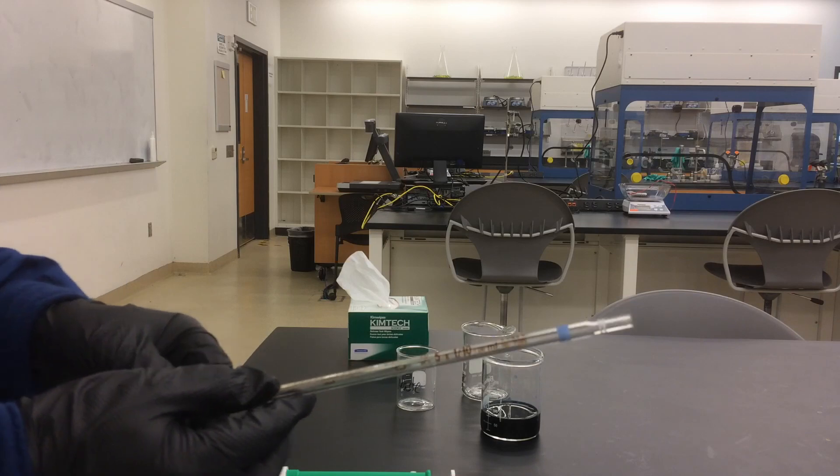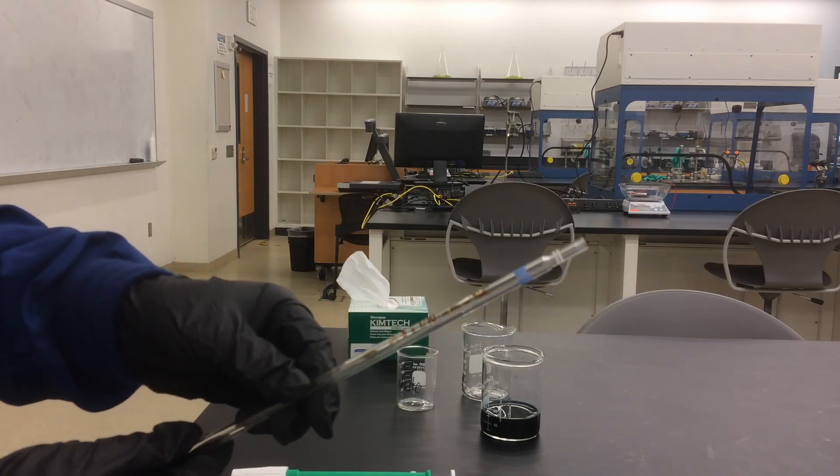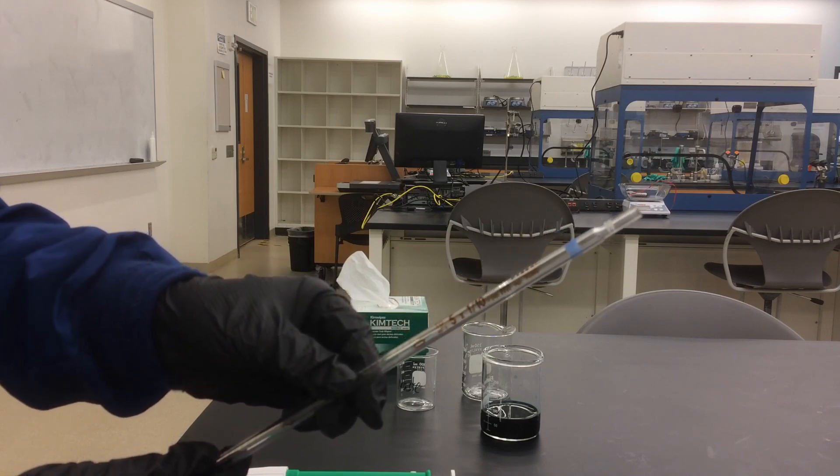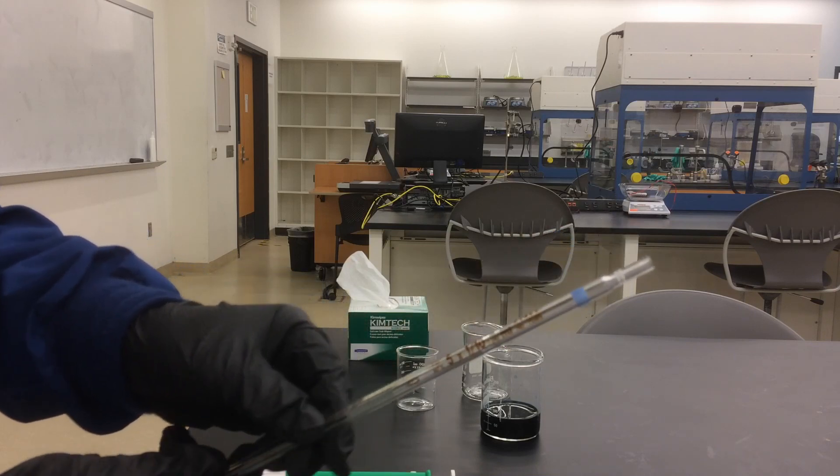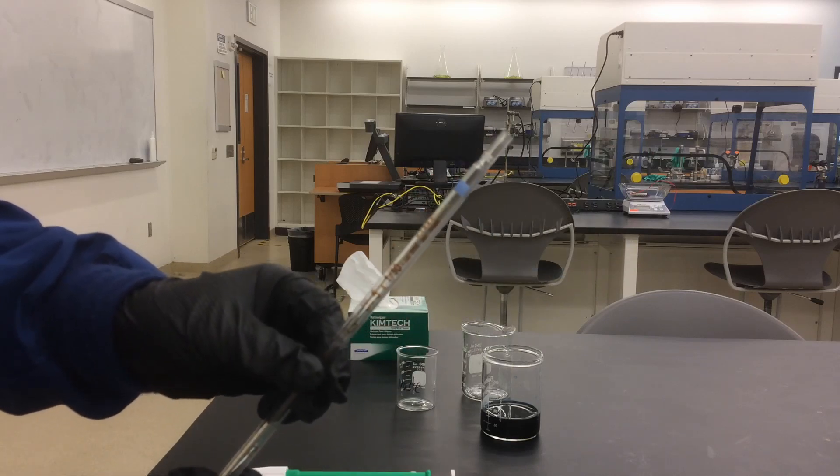Now, let me show you how to read the graduated pipette. Graduated pipettes are marked every 0.1 ml. This is a 5 ml graduated pipette.